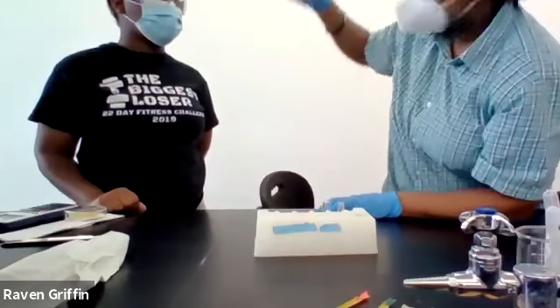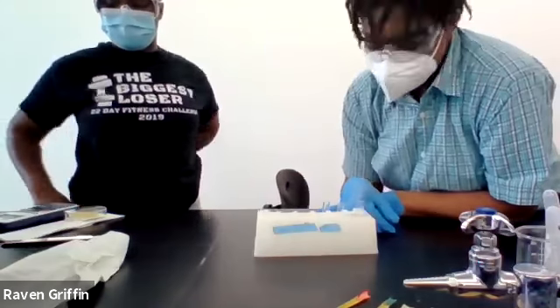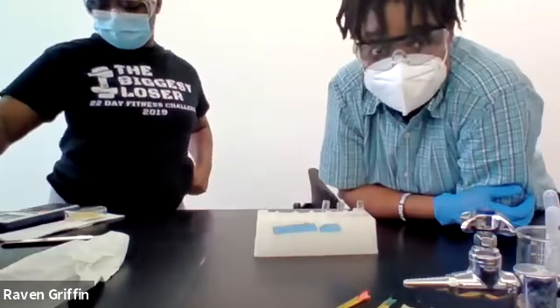Does anybody want to take a guess at what gas is coming off? Zinc plus HCl. Somebody nailed it. It's hydrogen gas being evolved, and you're making zinc chloride in the process. Actually, zinc dichloride, because it's ZnCl2, because zinc has a +2 charge. So, thank you for that.